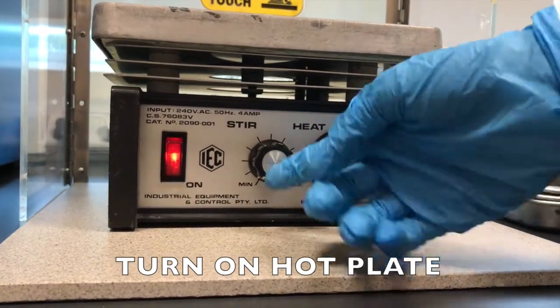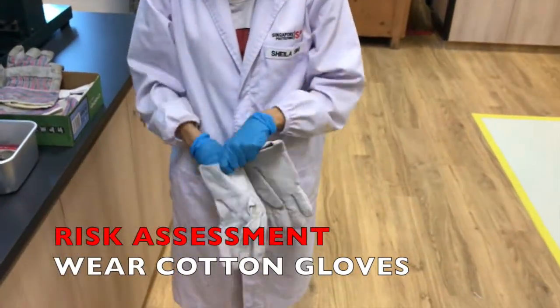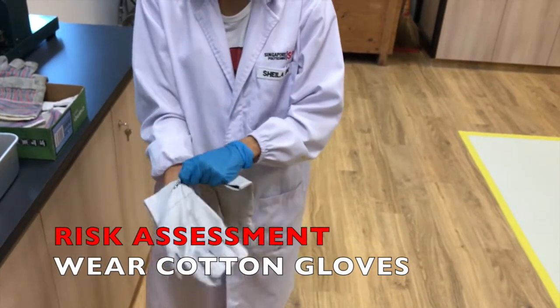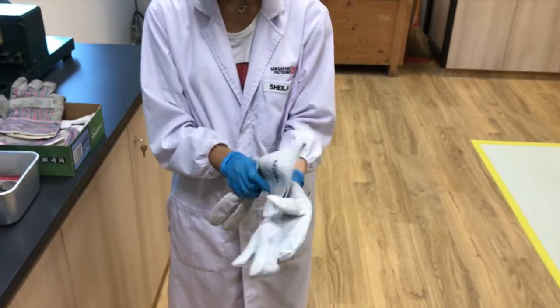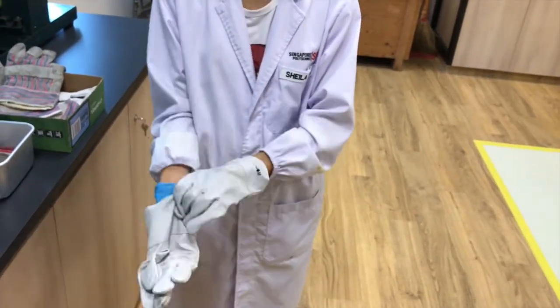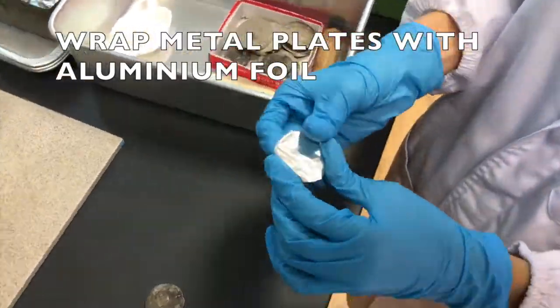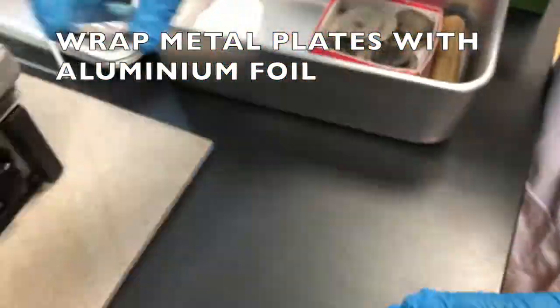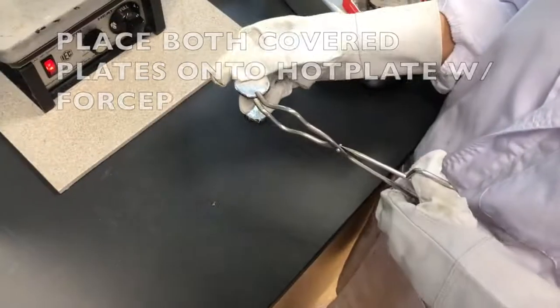Firstly, we will need to preheat our hot plate before sample preparation. It is needed to wear cotton gloves most of the time as we are dealing with polymer that can go up to very high temperature. It's classified under the personal protective equipment in the risk assessment as it can cause injury like scalding if not handled properly. Now, we will have to wrap aluminium foil around two small metal plates separately.